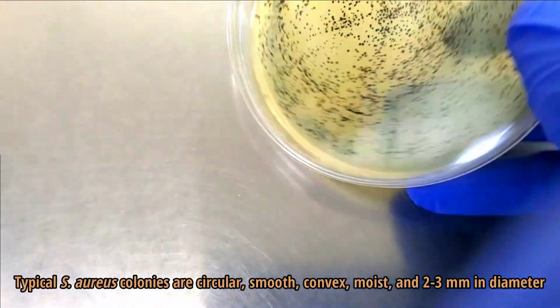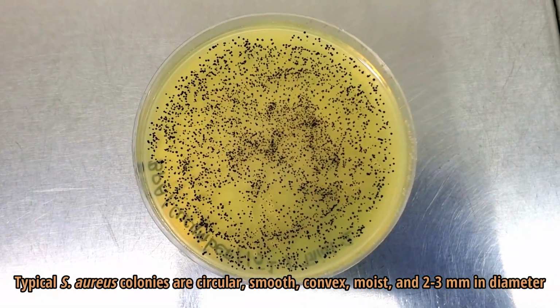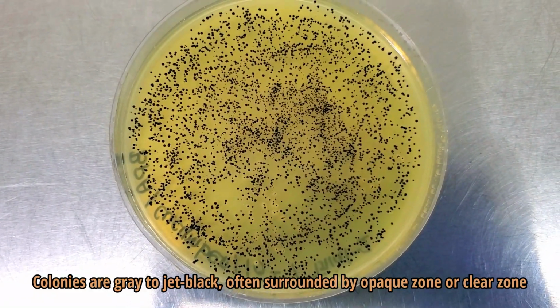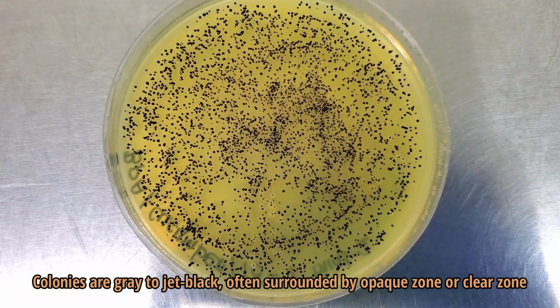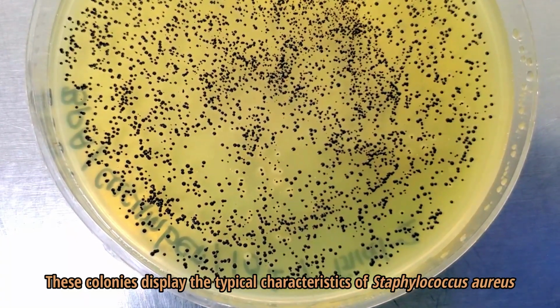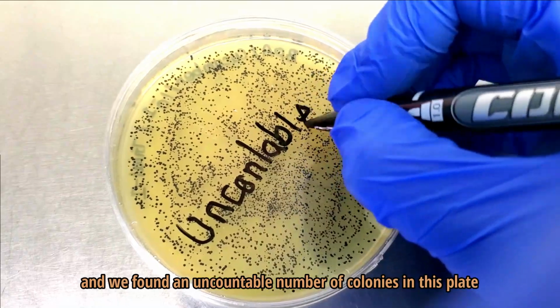Typical colonies of Staphylococcus aureus are circular, smooth, convex, moist, and 2 to 3 mm in diameter. Colonies are gray to jet black, often surrounded by opaque zone, and may have an outer clear zone. These colonies display the typical characteristics of Staphylococcus aureus, and we found an uncountable number of colonies.